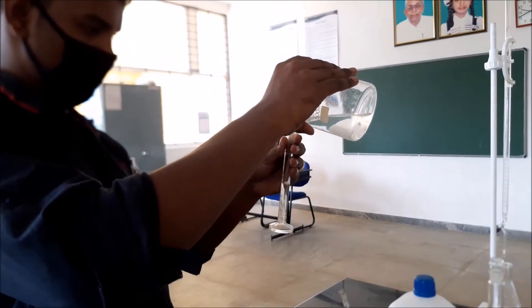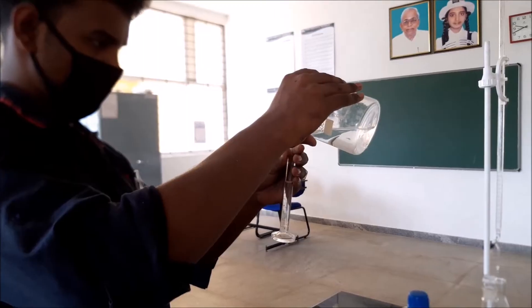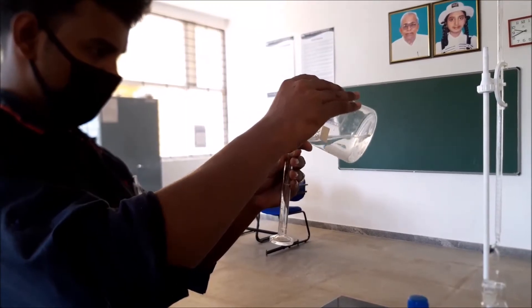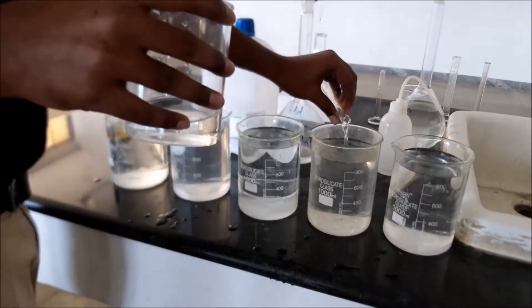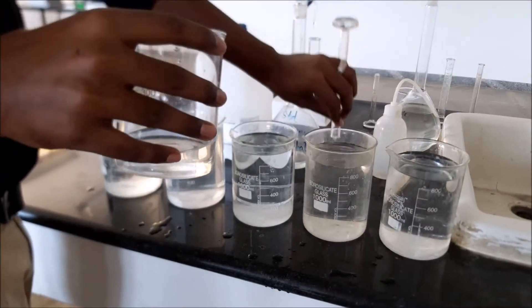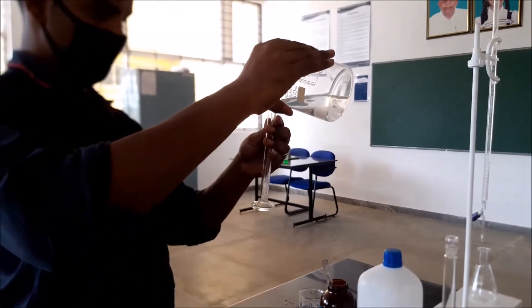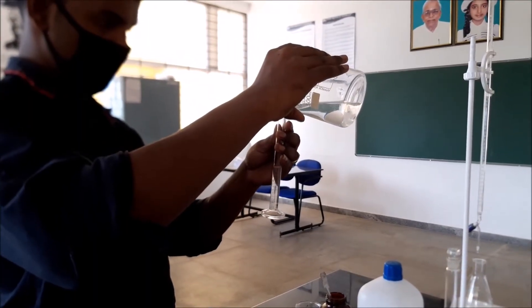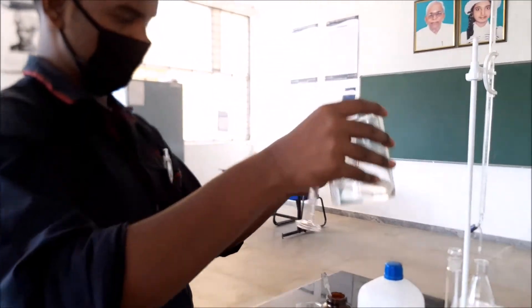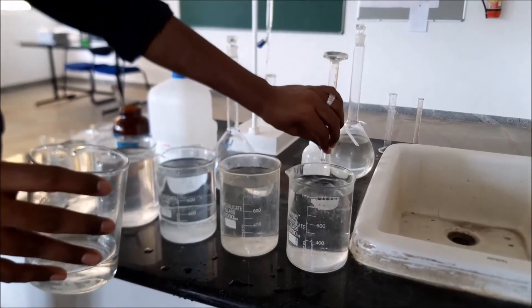Eight ml of chlorine solution is measured and added to the fourth beaker. Ten ml of chlorine solution is measured and added to the fifth beaker.